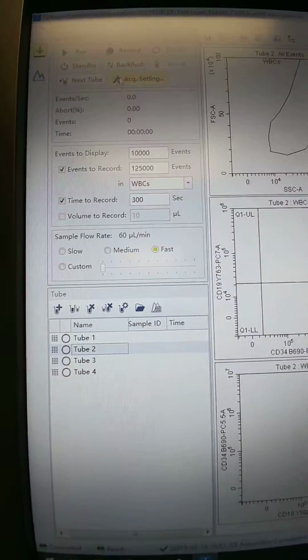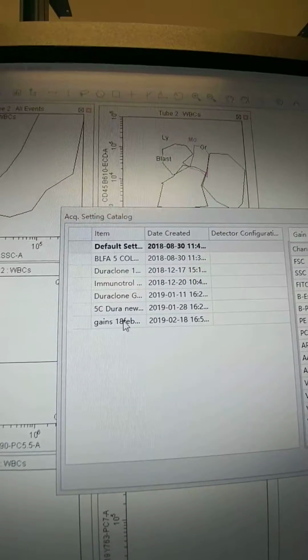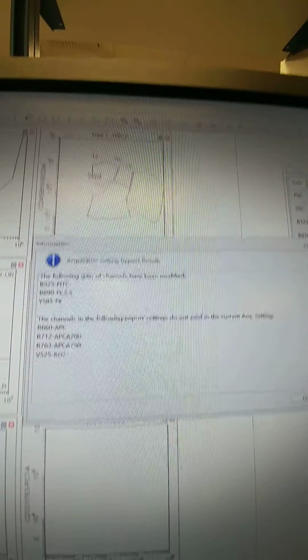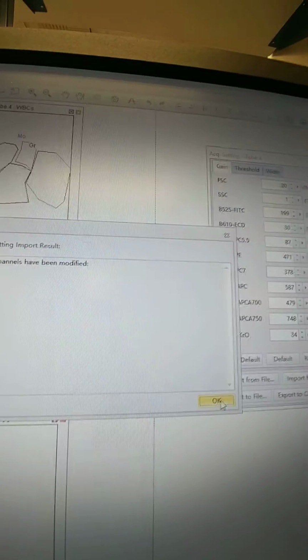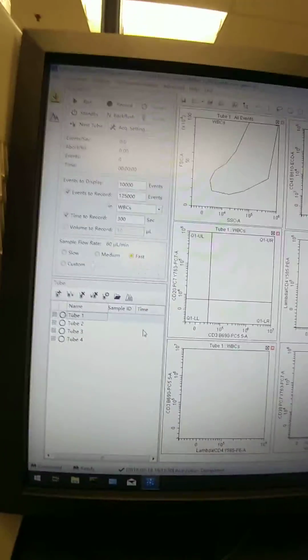Select tube 2, acquisition settings, same thing, import from catalog, and I want the ones we just saved. Tube 3, same thing. Import from catalog, gains, import. And then tube 4, and again you see those change, so import from catalog, click our new gain file, import, and close. So now we have the correct new gains for all the tubes.